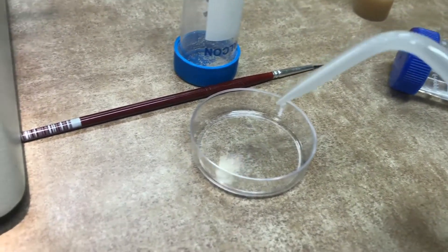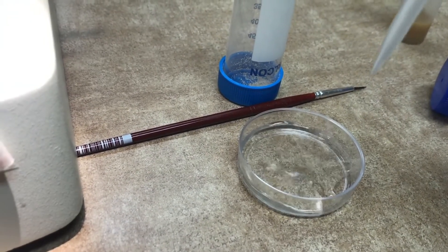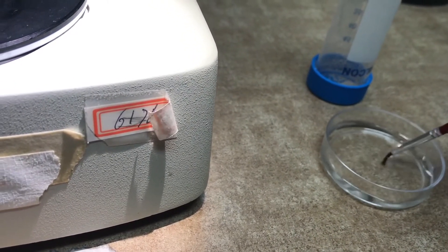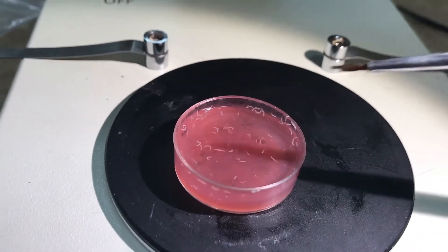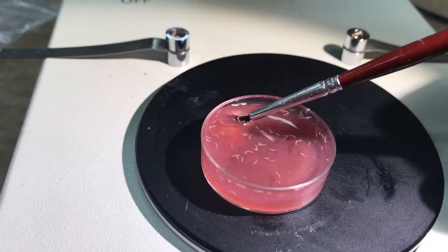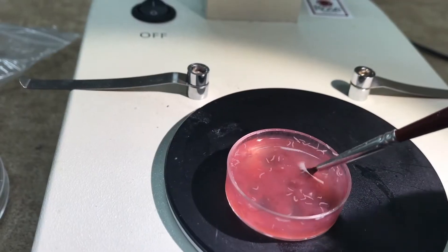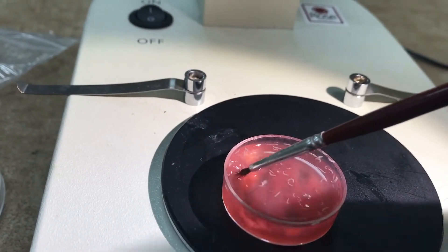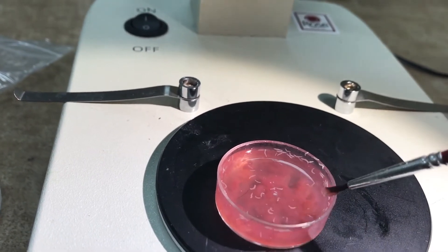Then add a little bit of water in your empty petri dish and clean your paintbrush, and then using the paintbrush, start scratching the media to remove your larvae from the media. They will float. Keep doing it until you remove all of your larvae from the media and they will float into the sucrose.